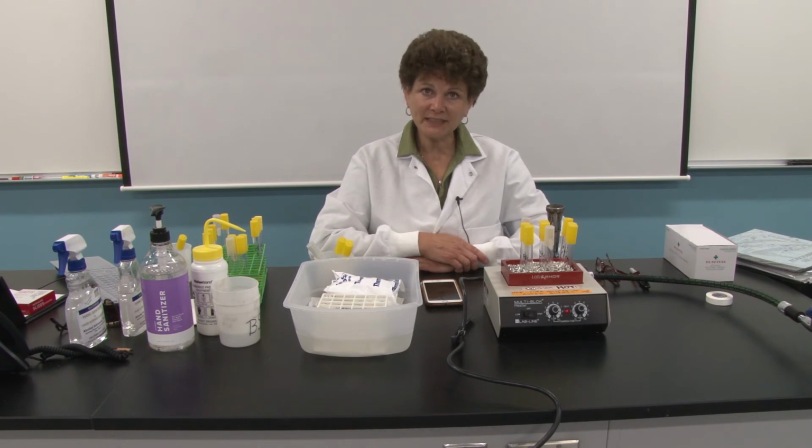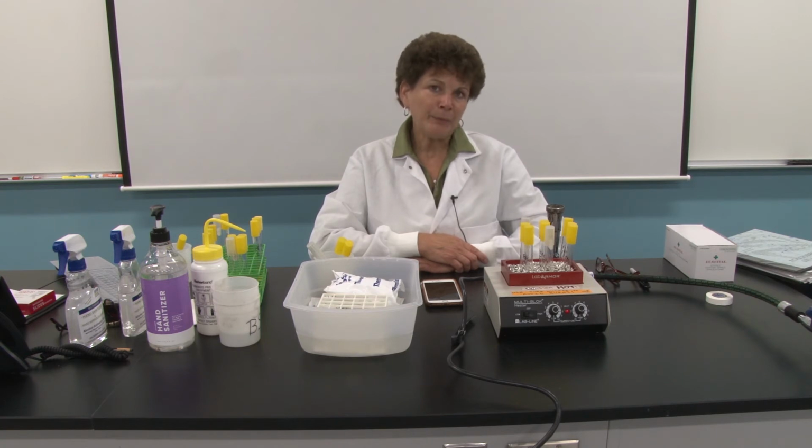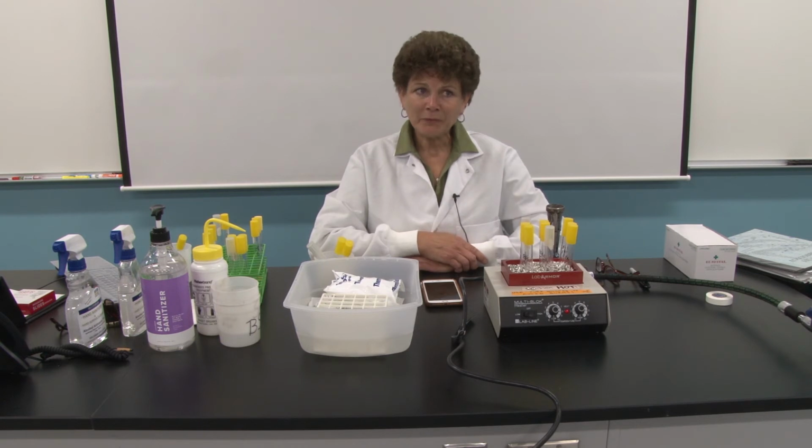Welcome back to session 8. Today we are going to set up the boiling for sterilization experiment. Before we do so, I want you to think about what we did when we prepared microbiological media in session 6. When we were done mixing all of the ingredients, we dispensed them into flasks, and we put those flasks in something called an autoclave. And an autoclave, we said at the time, was simply a pressure cooker that allowed us to achieve 121 degrees Celsius. And we maintained that temperature for 15 minutes in order to do something called sterilizing the media.